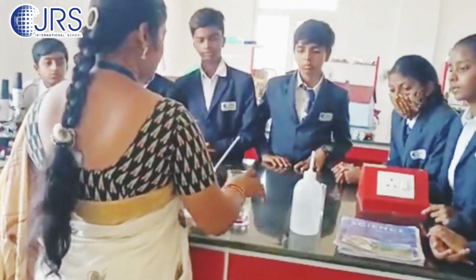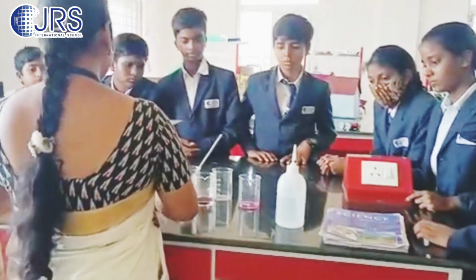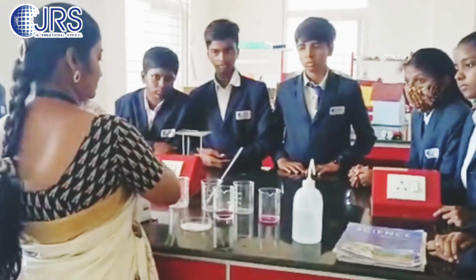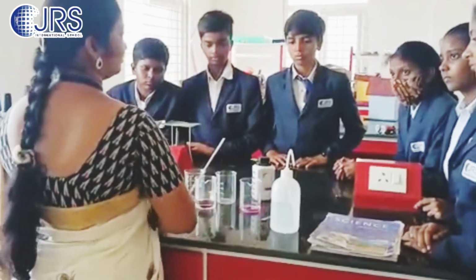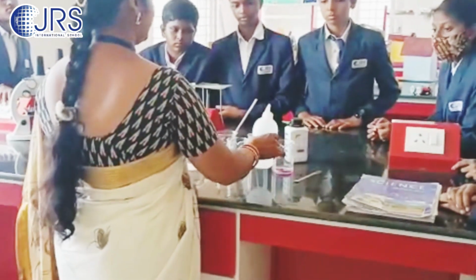Okay, so these are the experiments that were given in your textbook. So I showed this. Don't think this was not done by you, but it is small. Now you can perform your activities also. Nothing will happen. KMnO4 will not harm you. You can start your experiment.